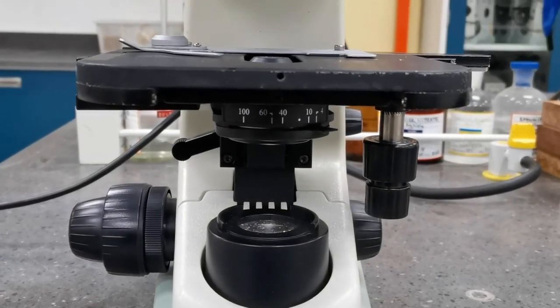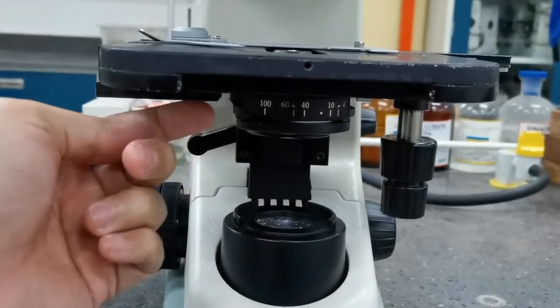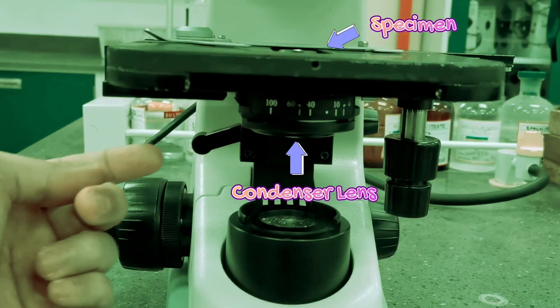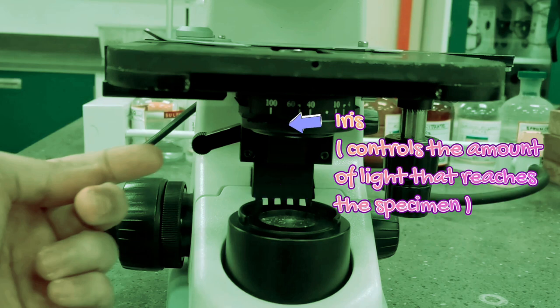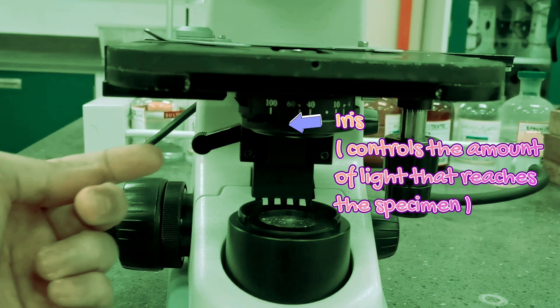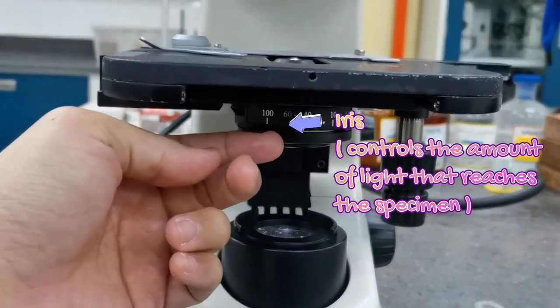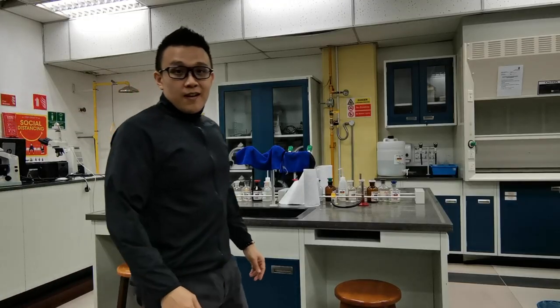Moving on, the next part is the condenser lens. This condenser lens focuses the light from the light source right onto your specimen. There is another part attached to it called the iris. The iris controls the amount of light reaching your specimen, and its function is to provide good contrast in the image you see under the microscope.